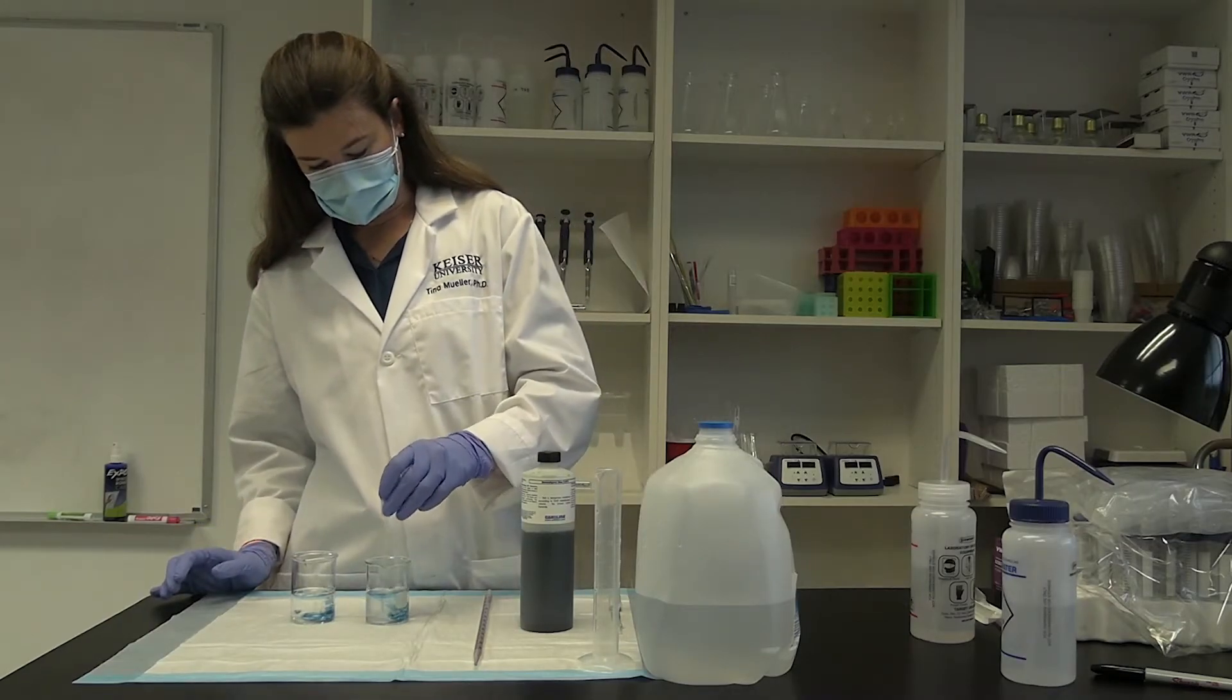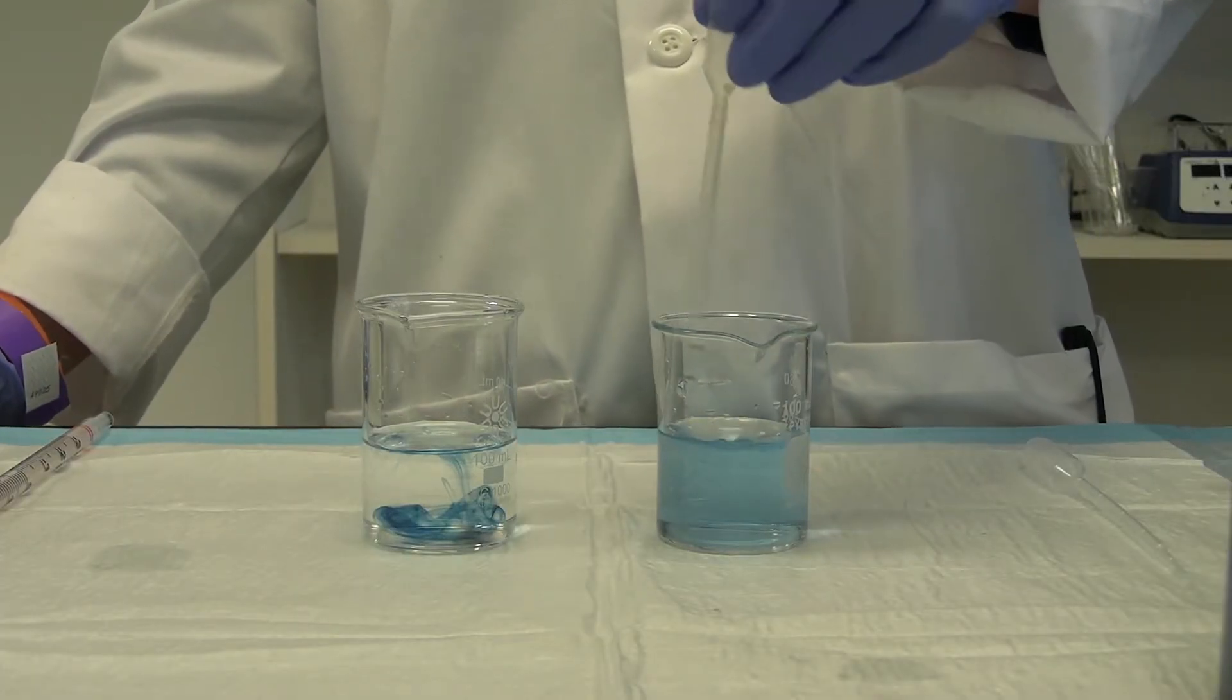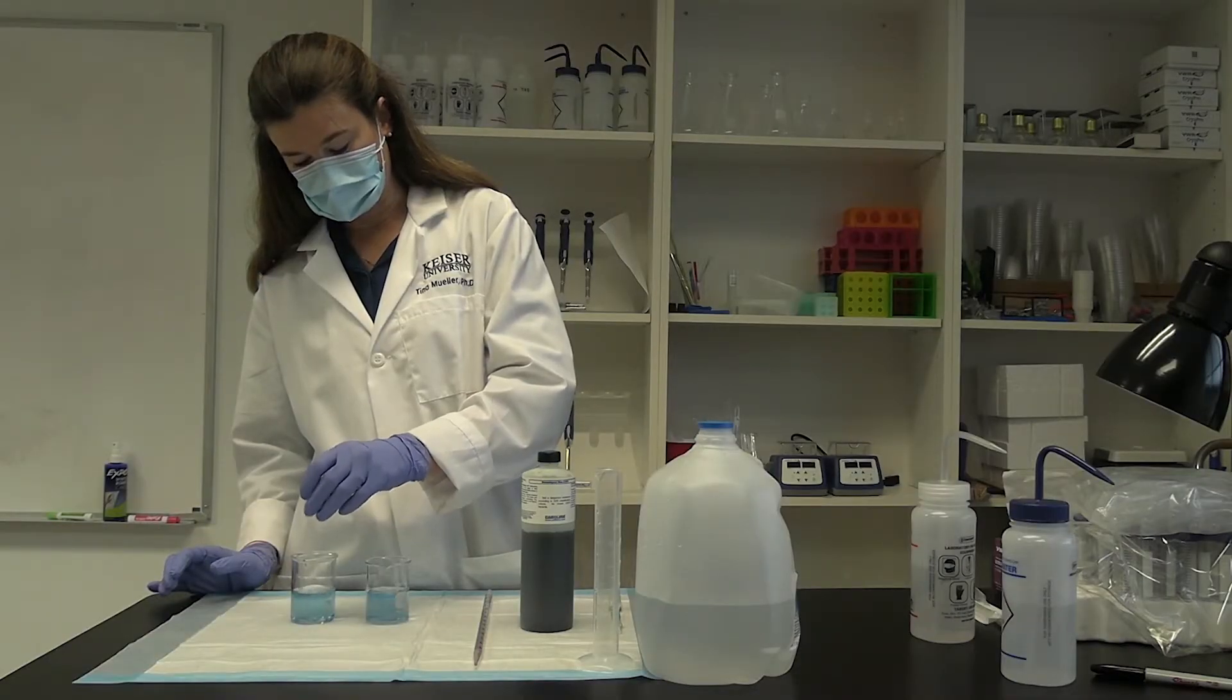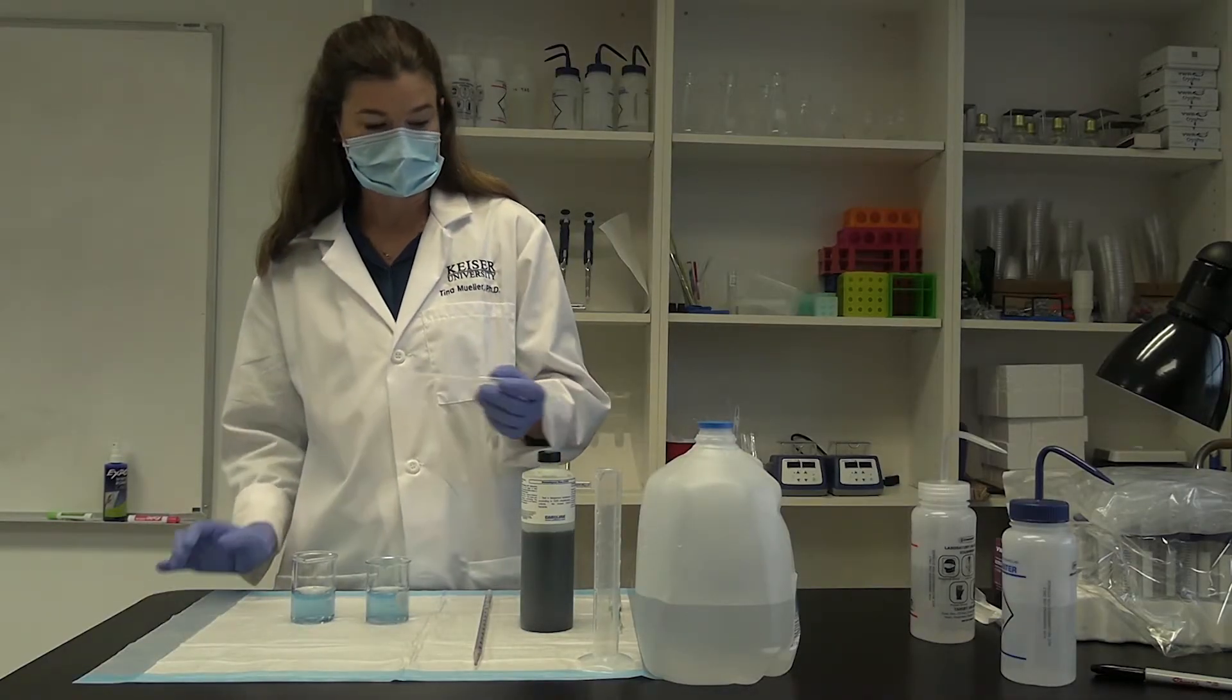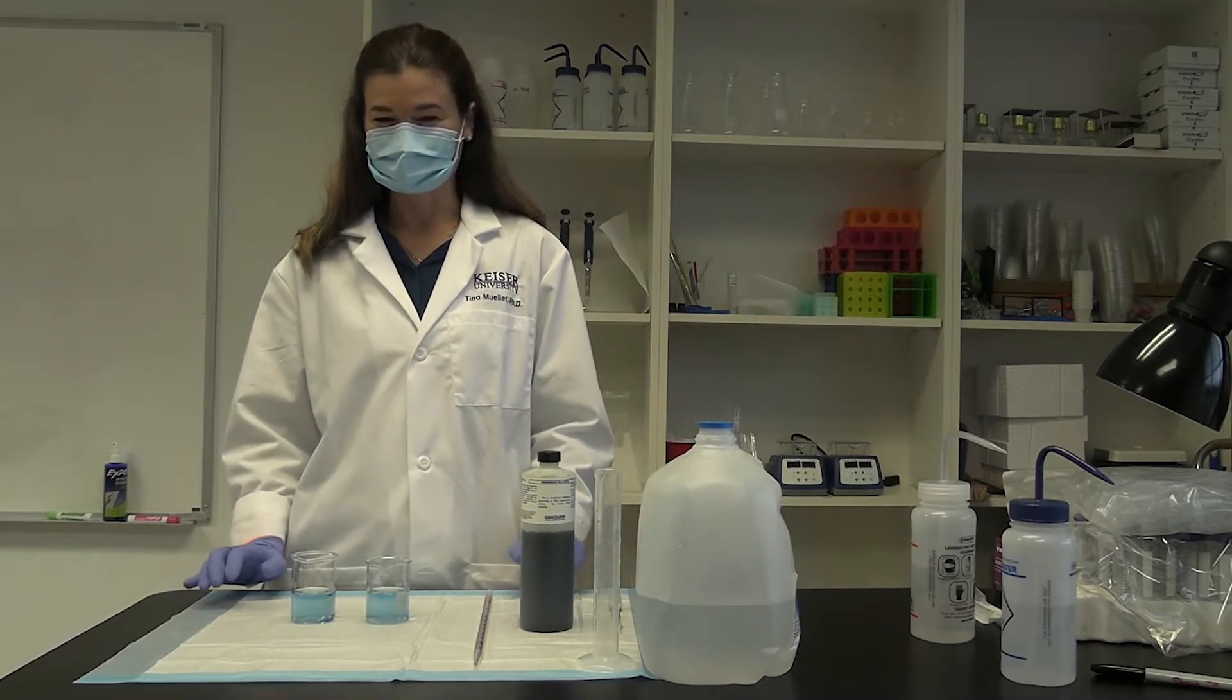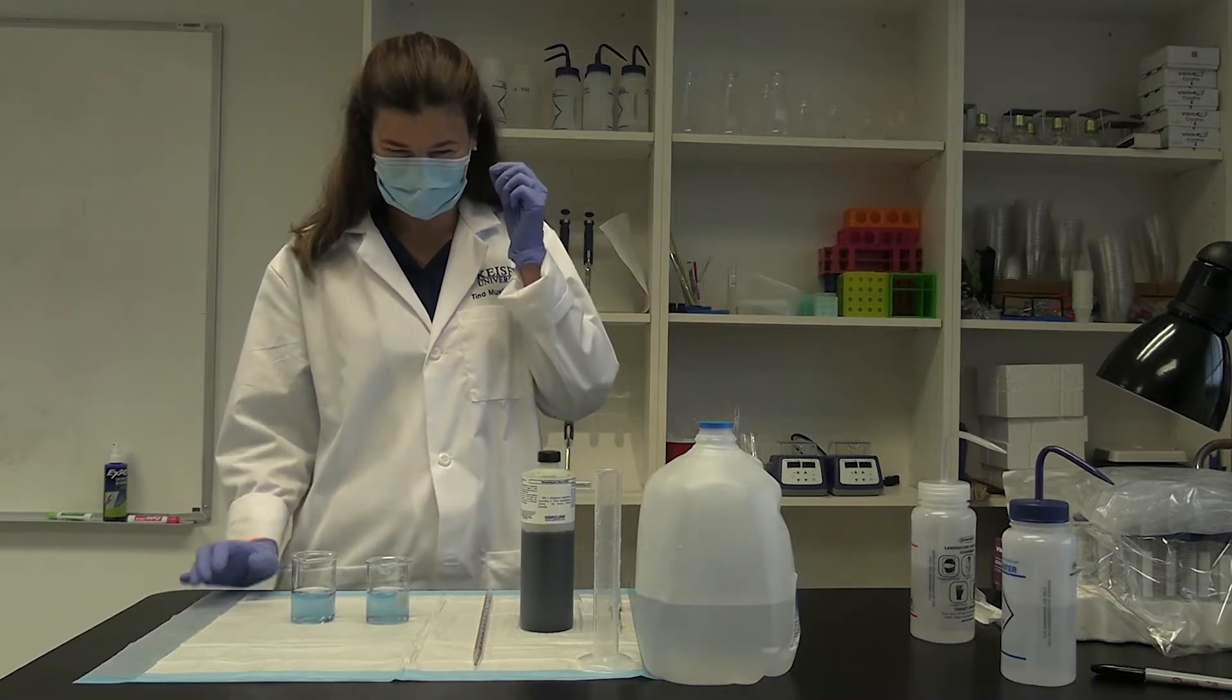And then you can swirl it around so that it's nice and blue. If you have a slightly alkaline water like this spring water, it should be good.